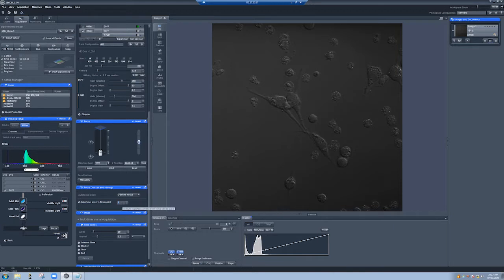What's going to happen when you do that is, I can't recall if it's right before the 5th or after the 5th image, it will shoot an infrared laser at the sample and find the same focus position as where it started. So what this means is the following. We are currently in some position in Z, which is defined by a certain distance from the interface between the cover slip, which is where the cells are lying, and the sample's media. That interface can be found by this focus device. And then what it does is it simply adds the spacing from that interface to find the same focal position you were in.